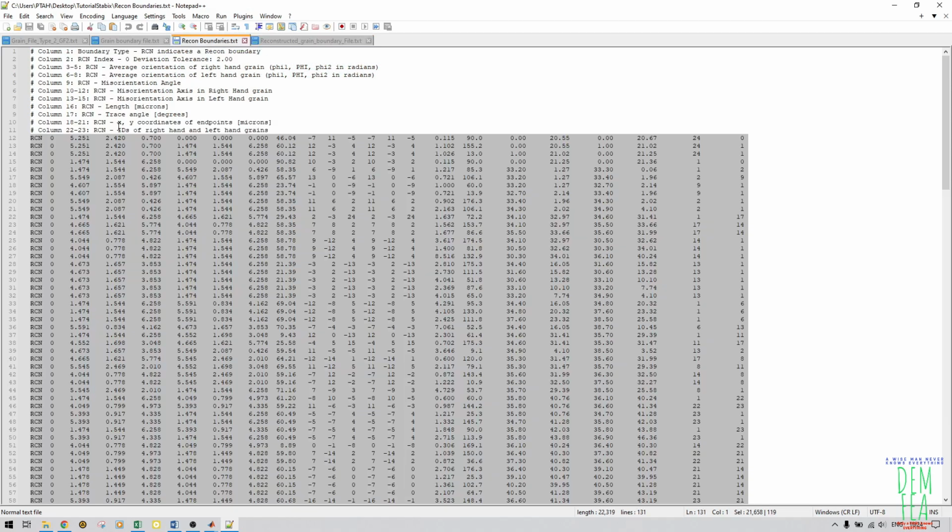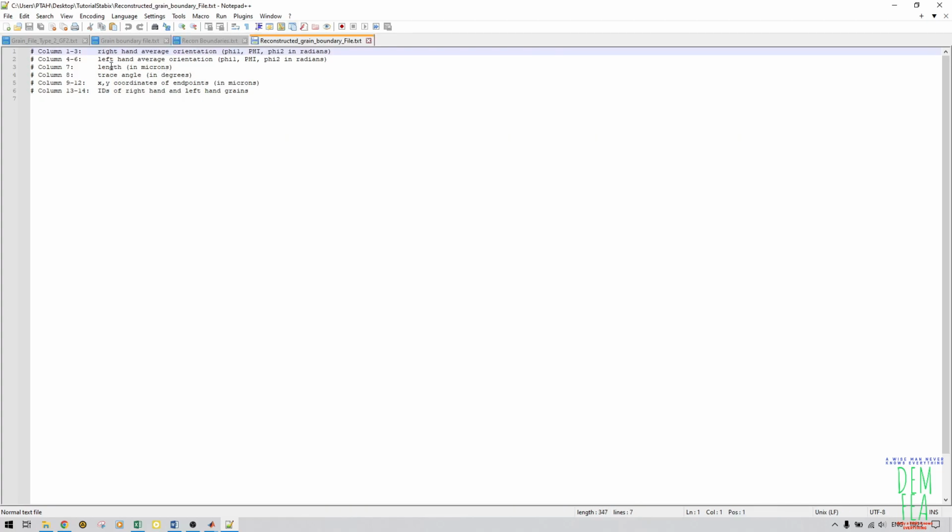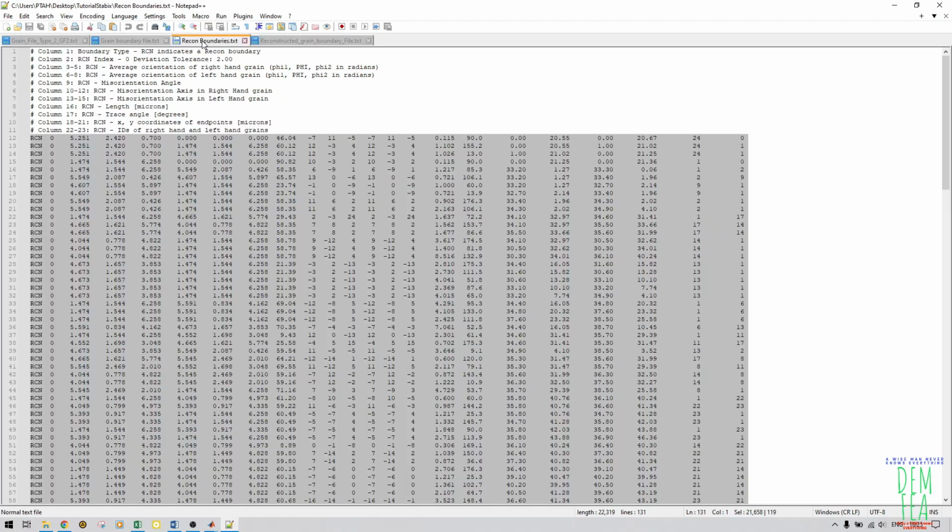But as you can see here, we don't need column 1, we don't need column 2, so we need from column 3 to column 8, because these are the ones that are responsible for average orientation of right hand grain and left hand grain, phi 1, phi 2 in radians. And also we don't need column 9 to column 15, because from this part, the next column that we need is the length. So now we need to delete all these columns.